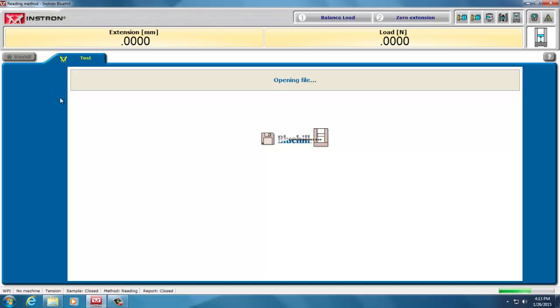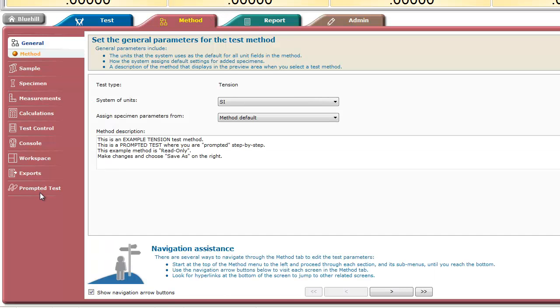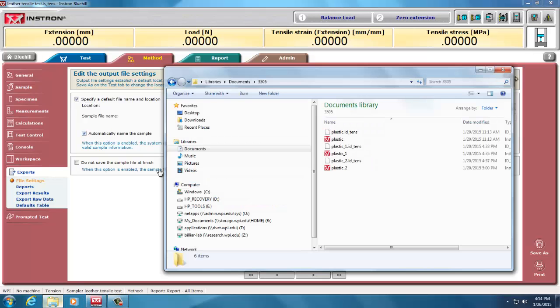When I continue the sample, I'm actually loading all the data up from that sample and the method that was tested. And now I can go on to my next specimen and test it, and it would be saved in the same database. But if I want to go back and find out where I saved it, I go into my method here, and I say, where did I say I was going to export it? Oh, I should see users Billiar documents 3505, and that is where I am here.